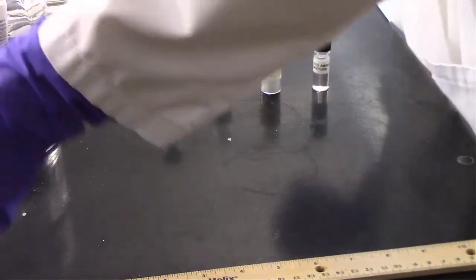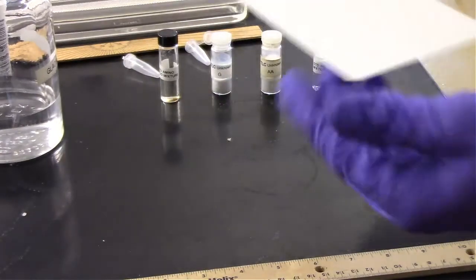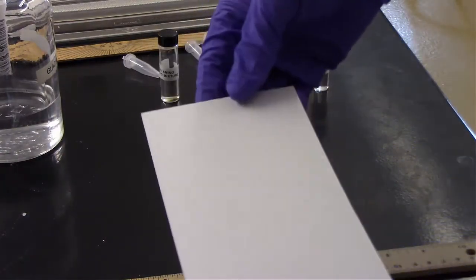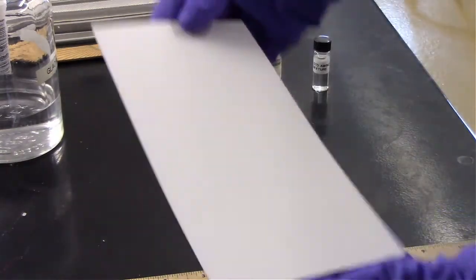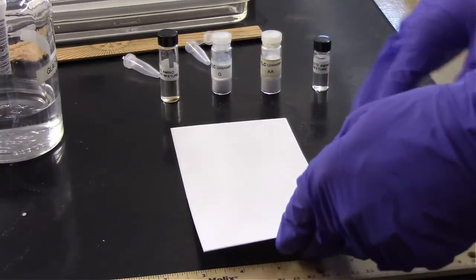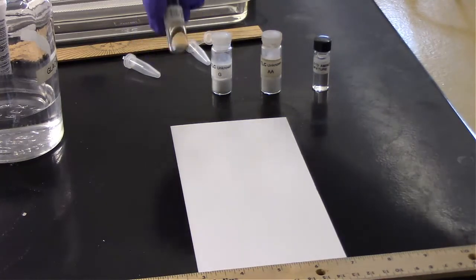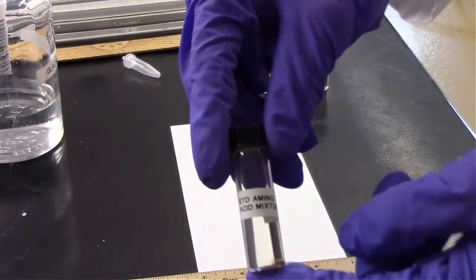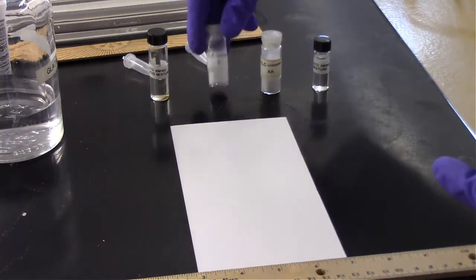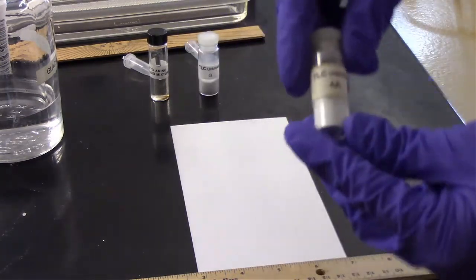All right, welcome to the TLC of Amino Acids lab. Your TLC plates are in this box here. Take out a TLC plate. Let's examine this. So we have our gel on this side, and this is the plastic side holding that gel. It's a little bit more shiny. So I'm going to lay that down with the plastic down because we're going to end up spotting on this side of the plate. For what we're running up the plate, we're going to have our 6 amino acid standard mixture. So we've got 6 amino acids there, and we're going to assess unknown G and unknown AA.